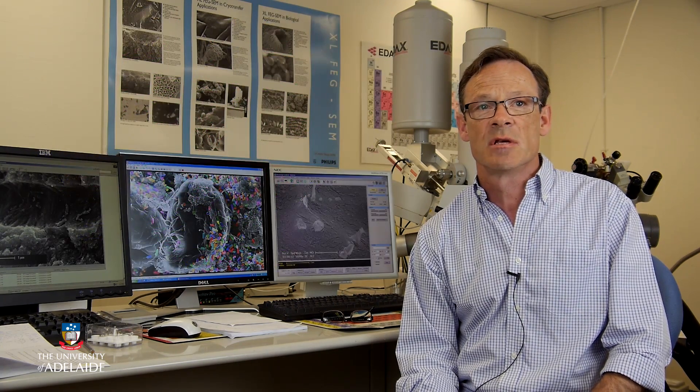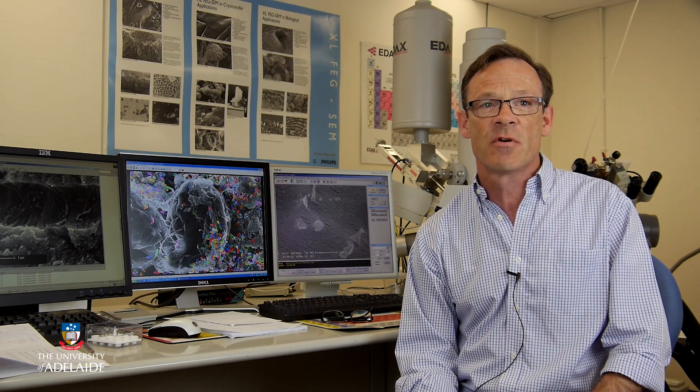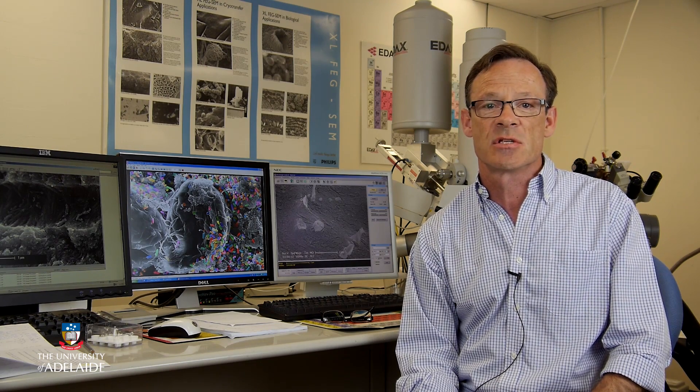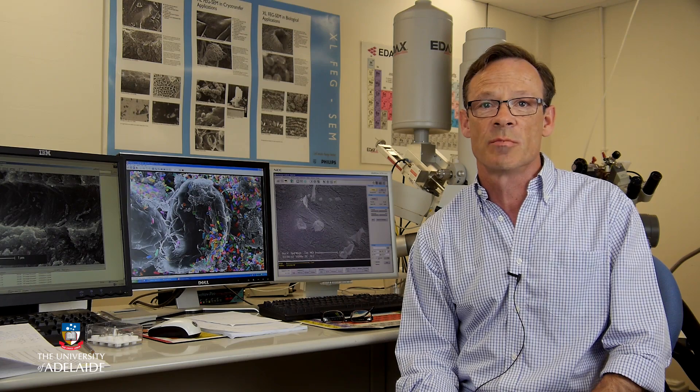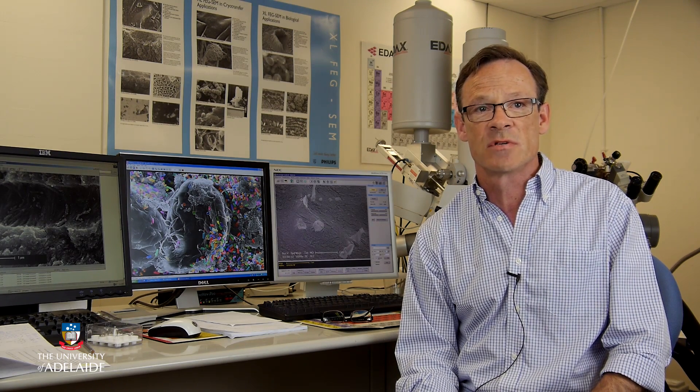To summarise, microscopes are essential scientific tools. They magnify tissues and enable us to study and interpret, often in incredible detail, the inner workings of cells.